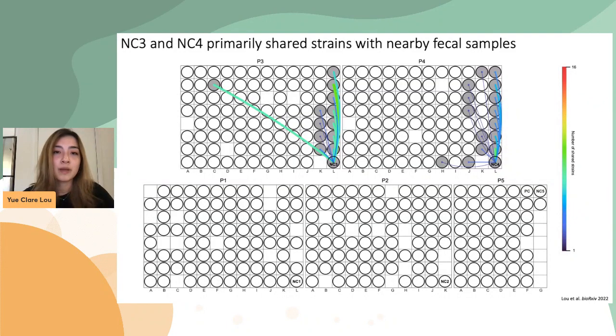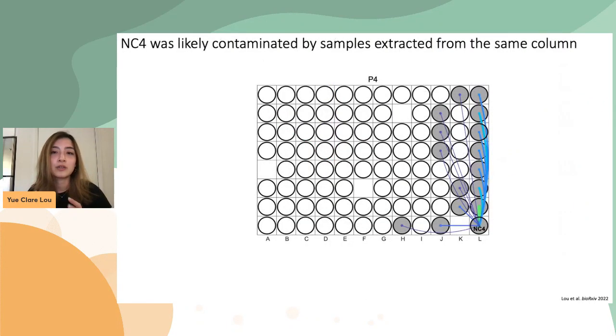I want to zoom in to talk about just one plate so you understand how to read such a plot. All the circles here represent samples. If a fecal sample shared strains with the negative controls, a line would be drawn between them. And the more strains the sample shared with the negative controls, the brighter and thicker the line gets. So in this case, the sample right here shared the most number of strains with NC4.